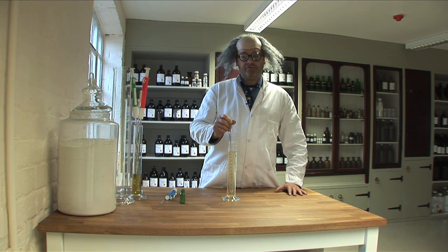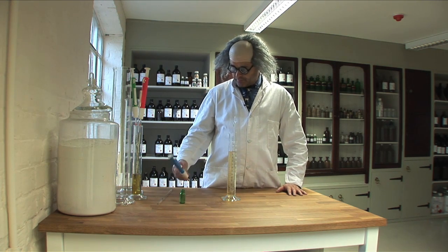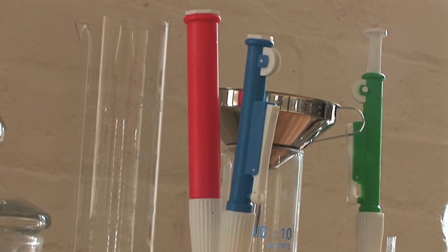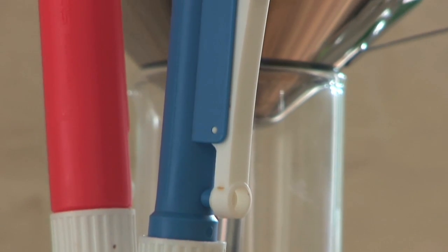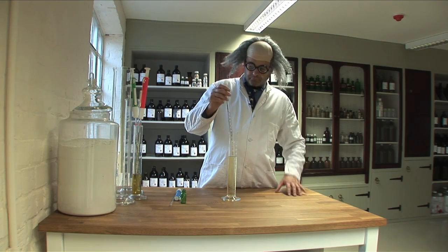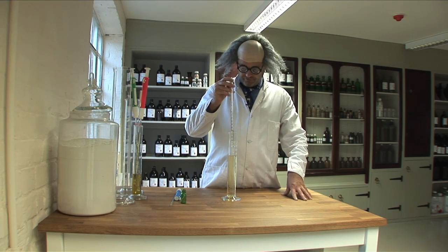The reason we use them is for accuracy, and I'm going to propose using pipette fillers because if you don't use pipette fillers, you can't really see what's going on and you can also get saliva in there, which is not a very good idea.